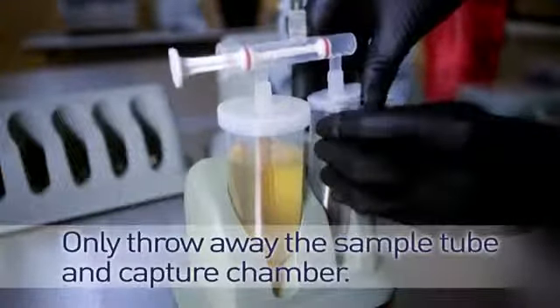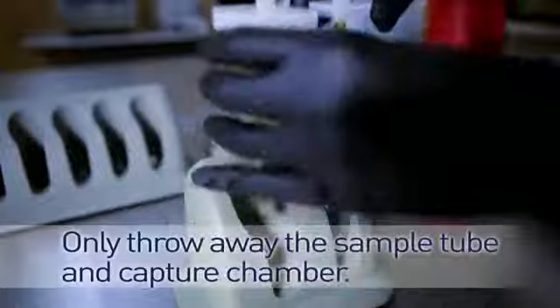Remove the cap from the elution tube, then throw away the sample tube and the capture chamber. These pieces are considered to be potential biohazardous waste, so follow all appropriate regulations.